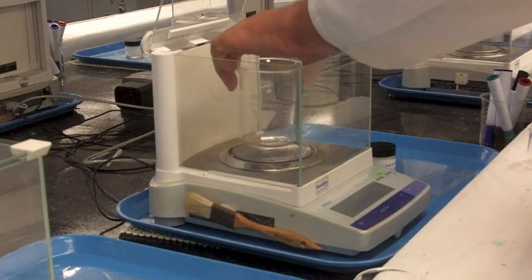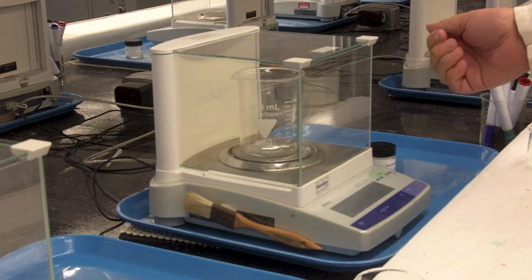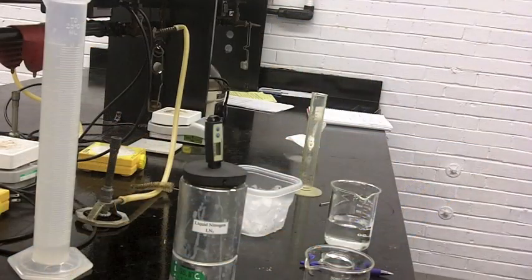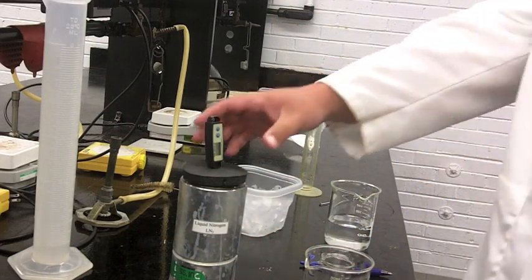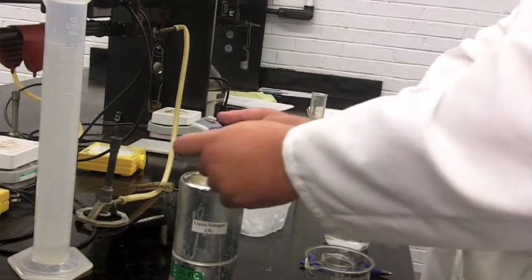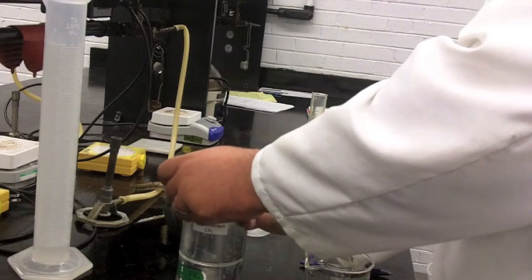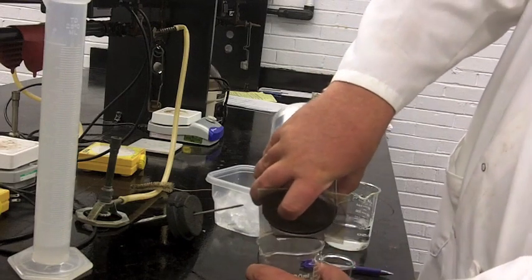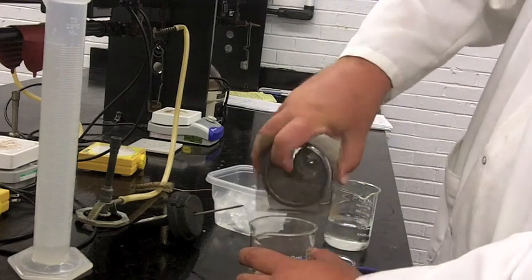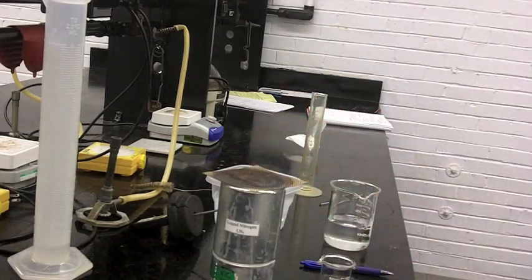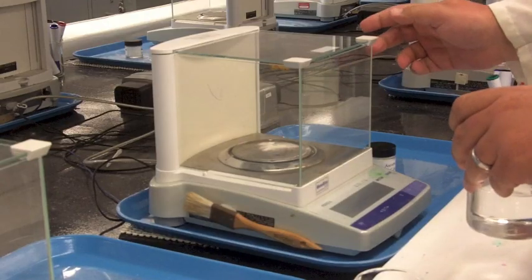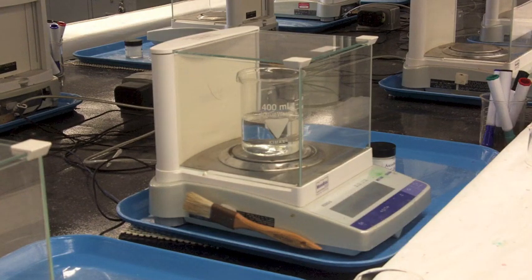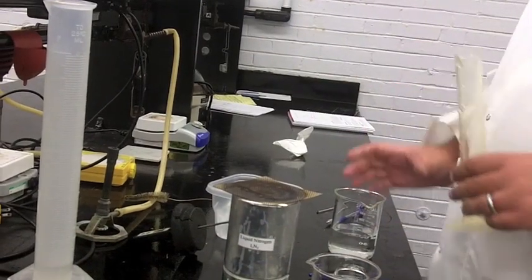While you're doing that, you can go get a larger beaker, something that'll hold your whole solution, and get the mass of that. Write that down. Then once you've reached equilibrium and the temperature isn't going down anymore—it's not going to warm up—just use the screen here, like I am, to basically do it like a martini shaker where you pour off the ice. The key is to try to get it all transferred. I think that's going to be the place where there might be a little difficulty, especially if it sticks to the edge. This may be a two-person operation. I did it as one. Then you've filtered off the ice and can go measure the mass of the solution. The key here is not to have too much liquid in there or else you have to break it up into pieces because the balance only has a certain size limit.